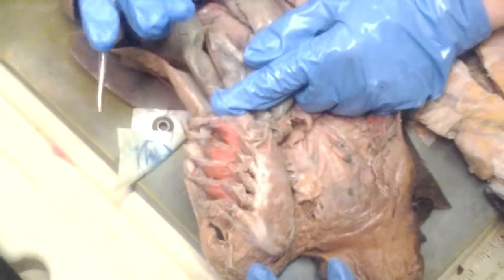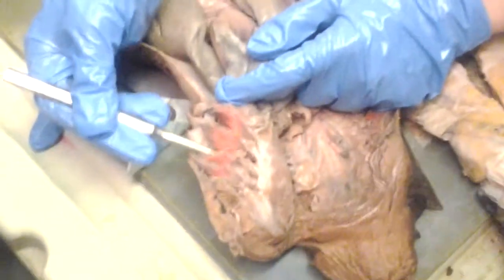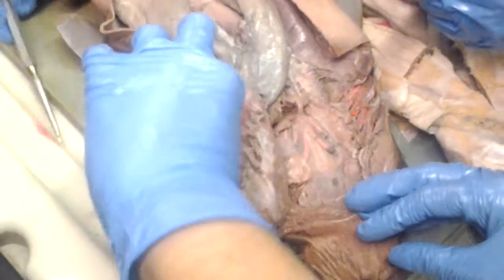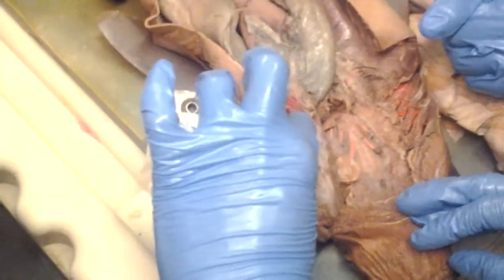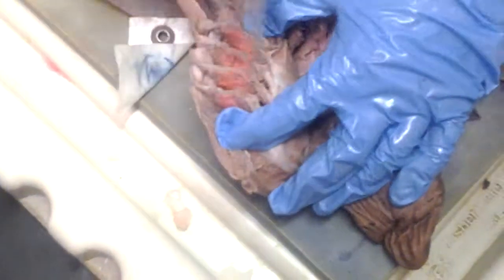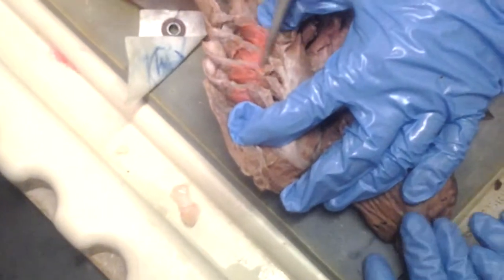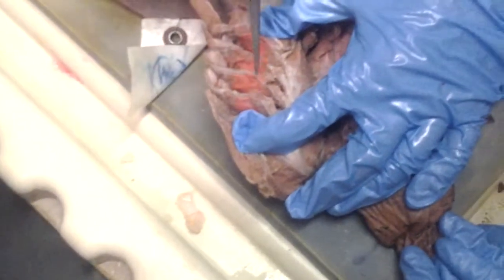So where's the septum? It separates the demibranches. All right, look. There's a holobranch. So the demibranch is this. The septum is this one, the middle. The septum separates the demibranches. It's connective tissue. Each one of these is the septum, everything in between the two lamellae, and it's connective tissue, and then you also have the gill arch cartilages.